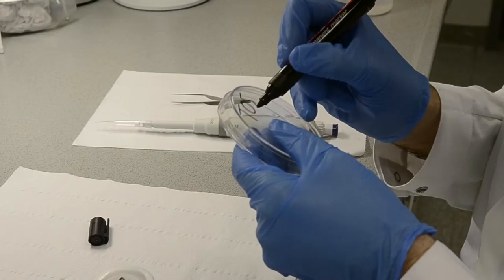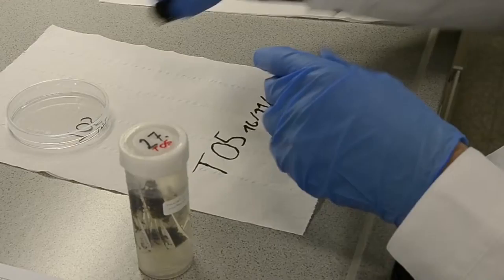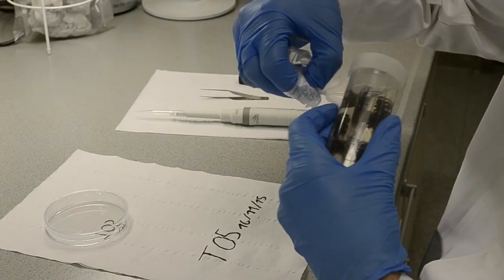Each tube contained hundreds of individual specimens. Those had to be dried before the extraction could start. We dried those on sterile Petri dishes, on which we also wrote down the ID and the date. Each sample had its own plastic container filled with ethanol.